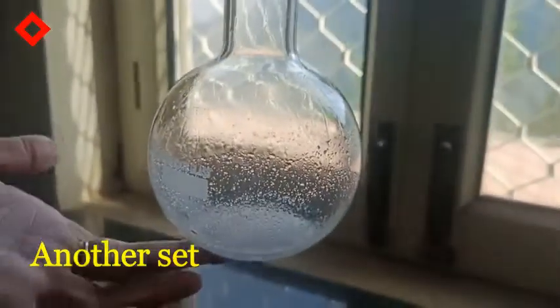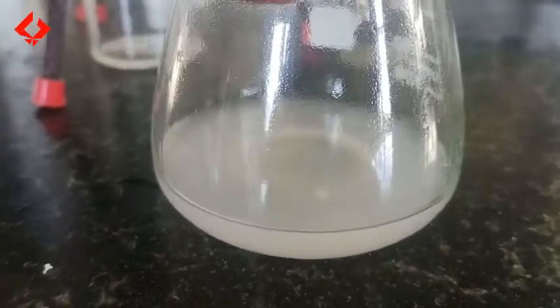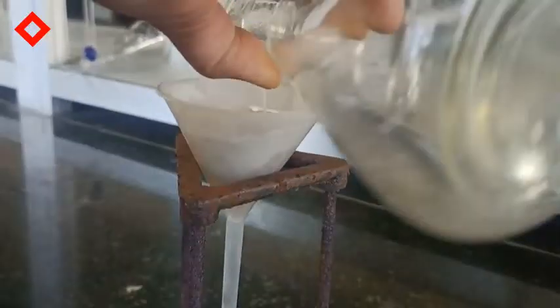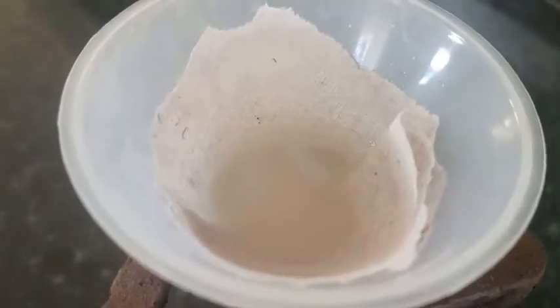In the second set, after removing it from the water bath, it looks like this, and at room temperature when I add distilled water we get white crystalline precipitates. These crystals are soluble in methanol, so after filtration I dissolved all the crystals into the methanol, filtered it, and left it at room temperature. I again get similar kinds of crystals from this set as well.